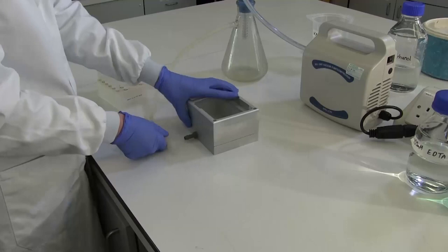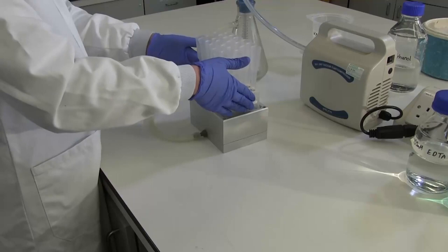Pipette 1.2 ml of the nickel NTA solution into the columns. Whilst pipetting, ensure that the beads remain fully mixed.